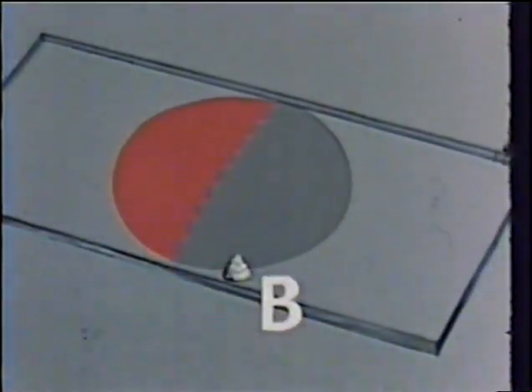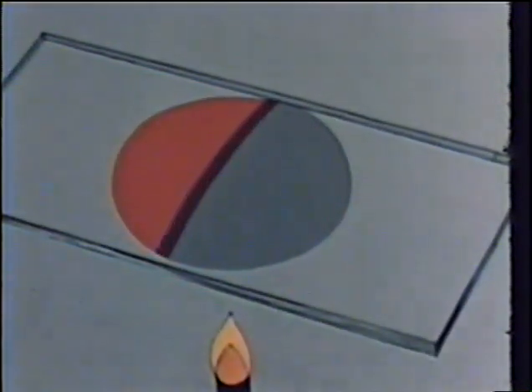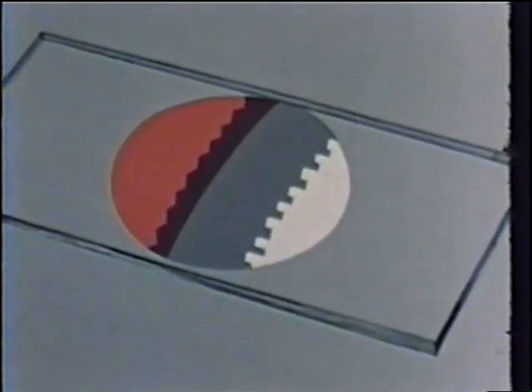A few milligrams of component A are placed on a microscope slide, covered with a cover glass, and melted. Crystallization of component A then occurs. Component B is then placed at the outer edge of the cover glass and melted so that it flows under the cover glass into contact with component A. On further heating, all of component B and part of component A are melted. Crystallization of the two components is then observed as the preparation cools.